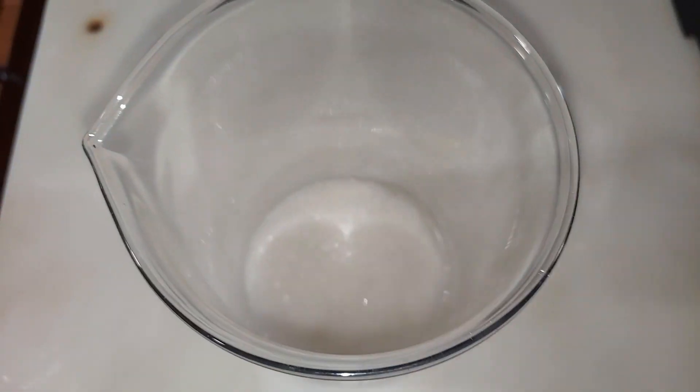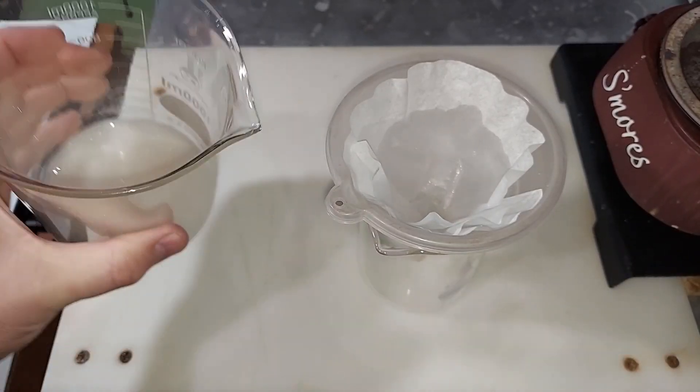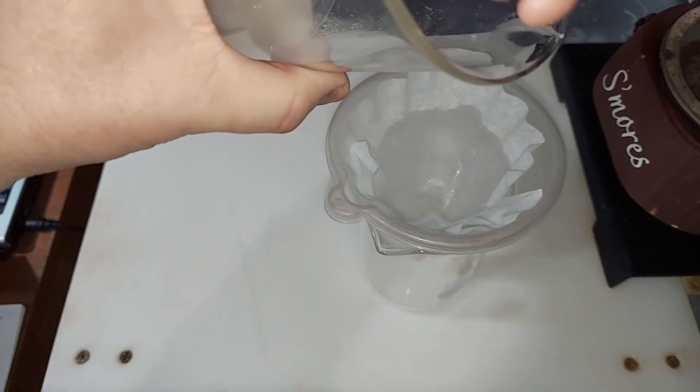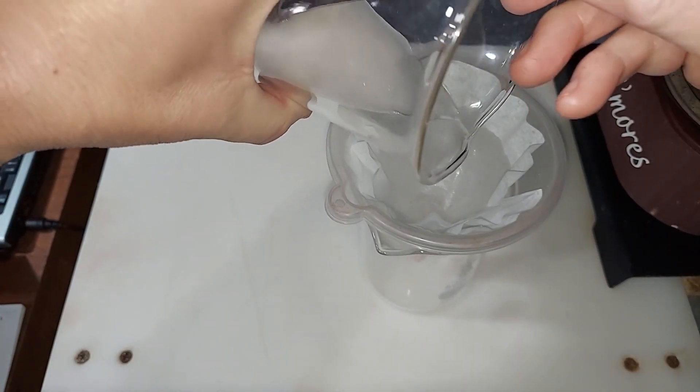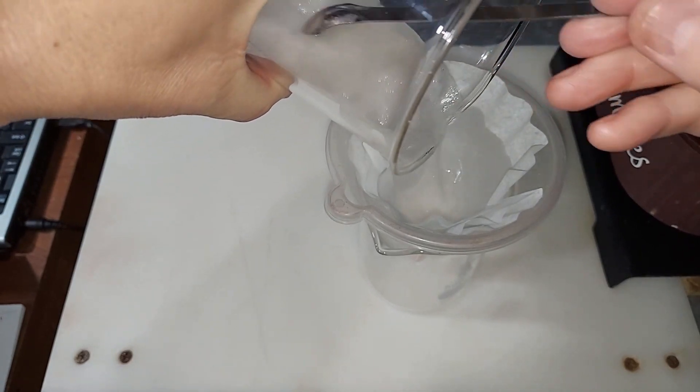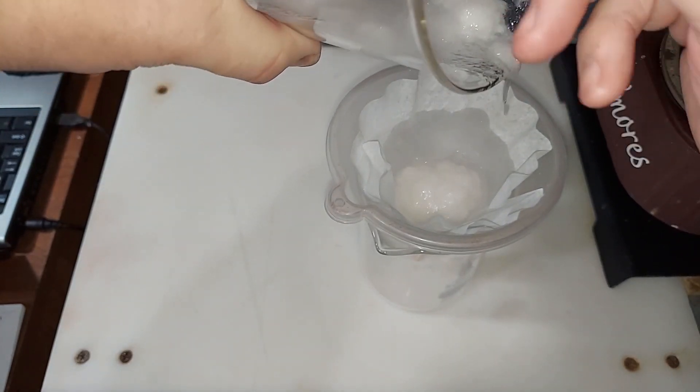Okay, so I'm just going to be scraping out all the stuff in here. Of course this is super straightforward, and filtering it, that's going to take some time.